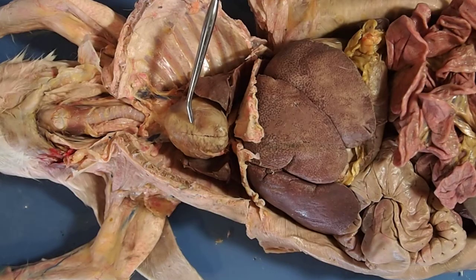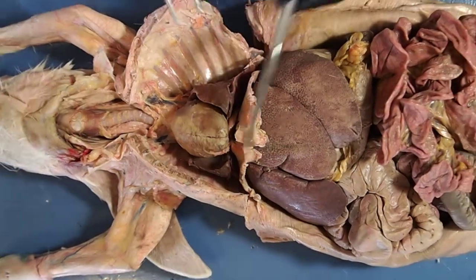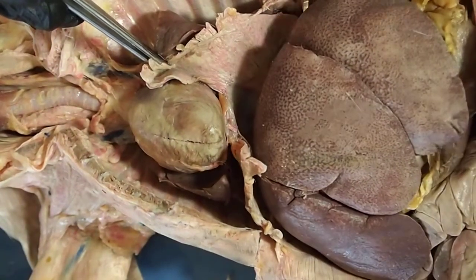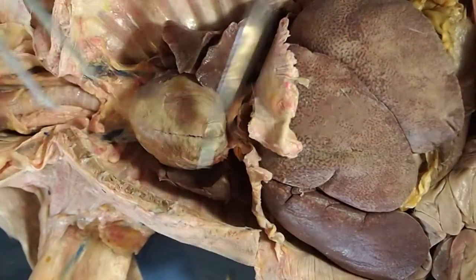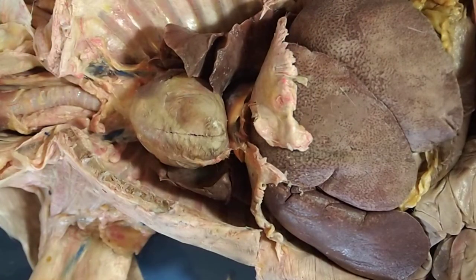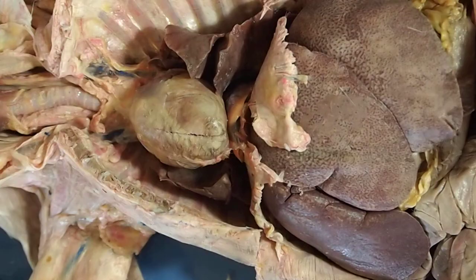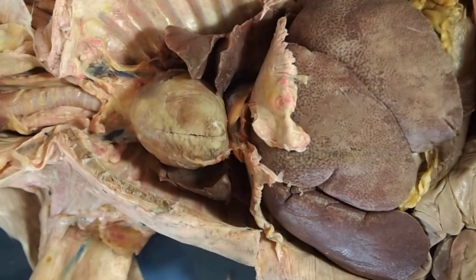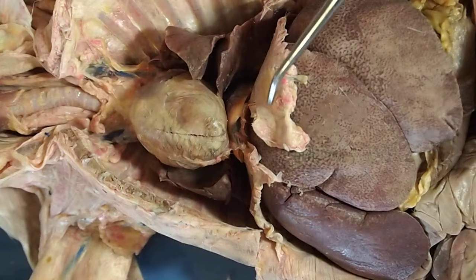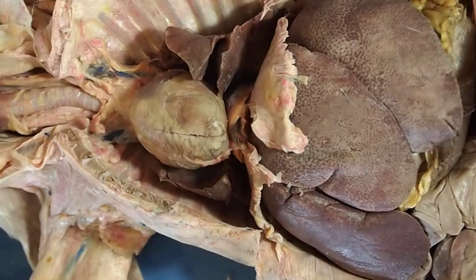As we transition from the thoracic cavity into the abdominal cavity, notice this muscle right here — the diaphragm. It goes all the way back onto the back of the body wall. Fun fact: if you like traditional beef fajitas, the cut of meat called skirt steak is actually the diaphragm of the cow. Chicken fajitas use breast meat, but traditional beef fajitas — you're eating the diaphragm.